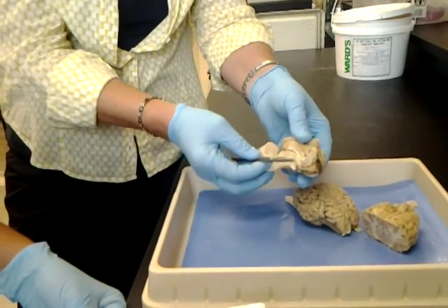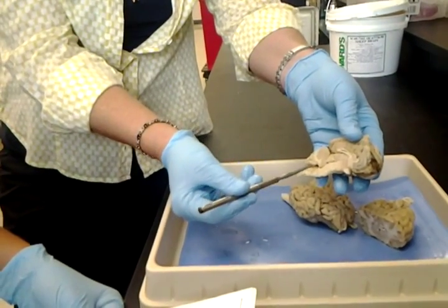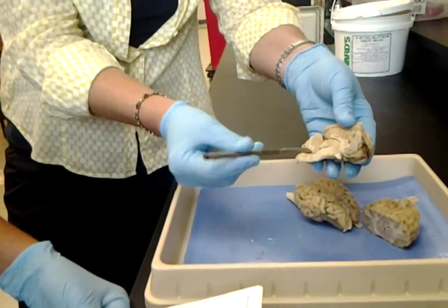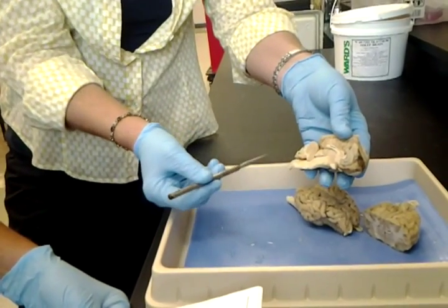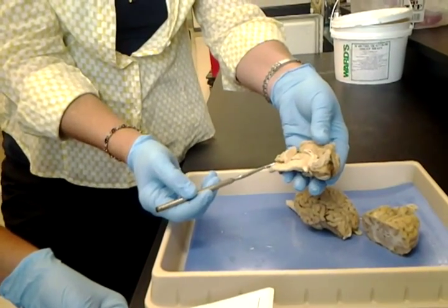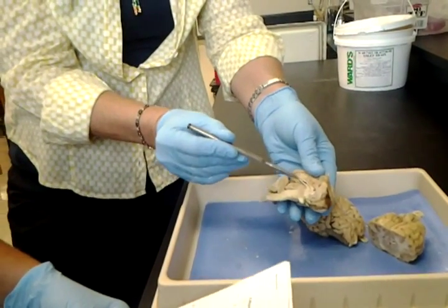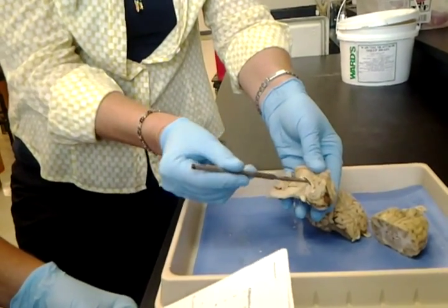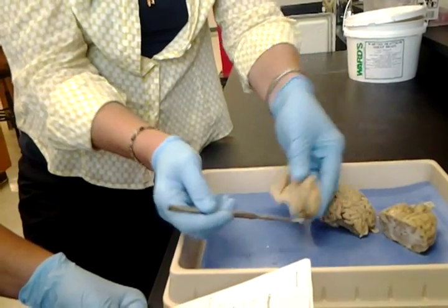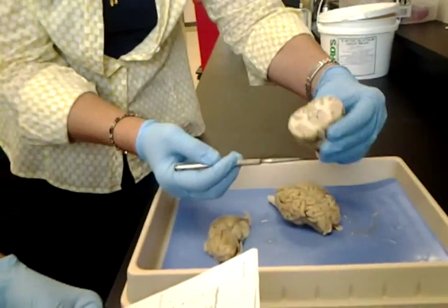Fourth ventricle. I'm going to see this view here. It's right at the base of the arbor vitae. Remember, ventricle is a chamber. So that's fourth ventricle. Hypothalamus is pretty tough to find on the sheep. Lateral sulcus. Lateral ventricle we mentioned already. One way to see it is here. But if I cut the brain in a frontal section down like this, I end up seeing it this way. Whoop, upside down.